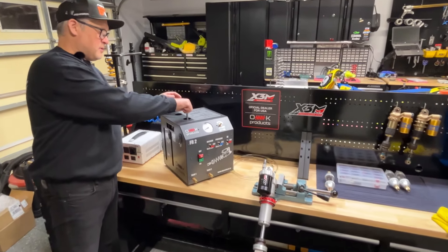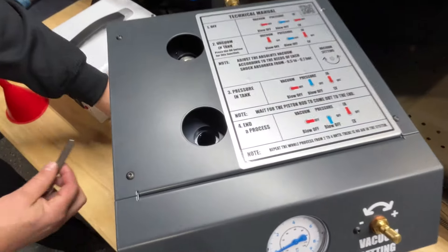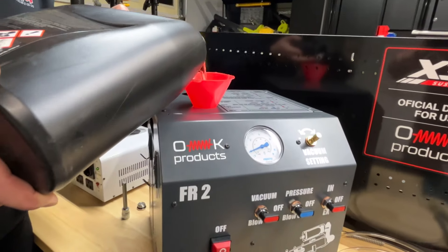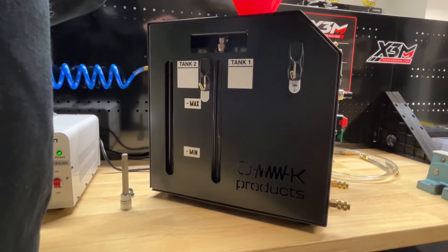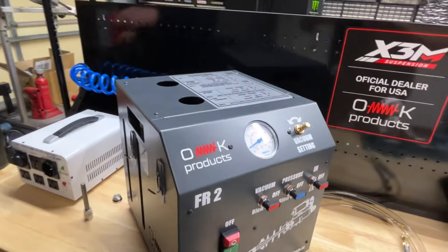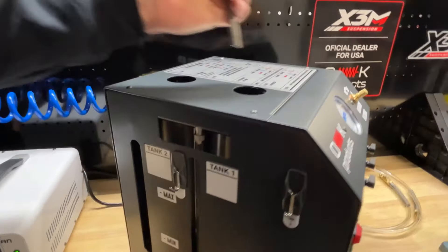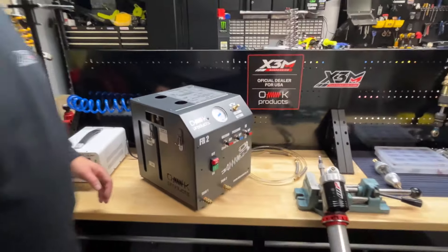Take your Allen head tool, open the socket, open the filler. It's very simple — open it up. We use the funnel and fill it up with oil to our maximum line. This is plenty for now. We clean this off and put our plug back.